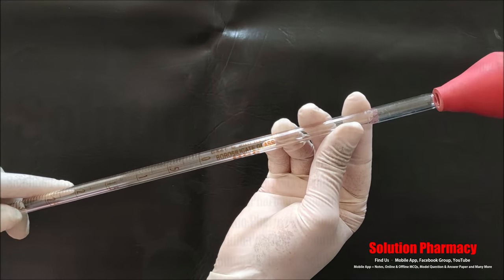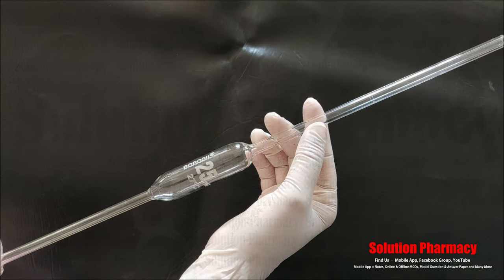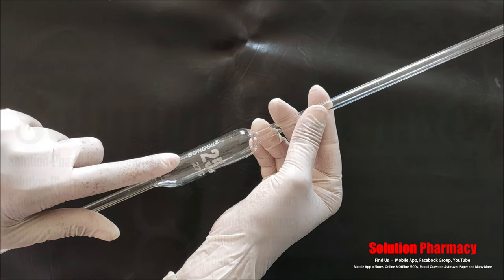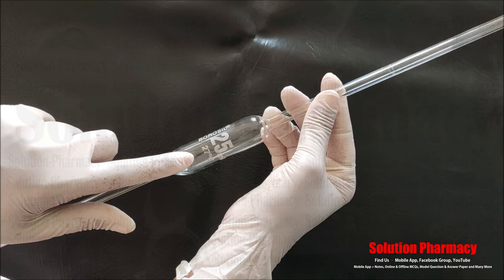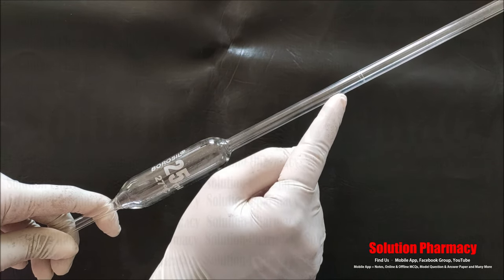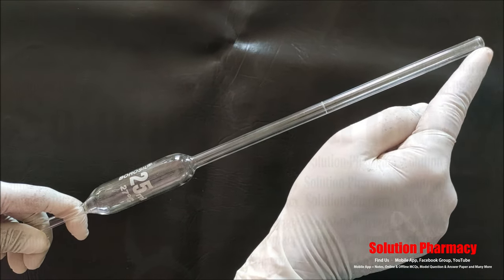After measuring the volume we transfer the liquid to a container. Besides the 5 ml size, graduated pipettes are also available in 1 ml and 10 ml. Next, this glassware is called a volumetric pipette. With this volumetric pipette we can measure a specific amount of liquid — this one is 25 ml. It provides very precise measurement, and a rubber bulb is fitted to the upper part to draw the liquid.